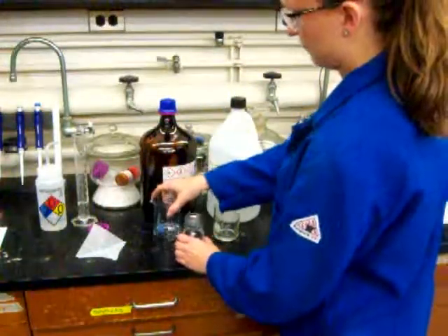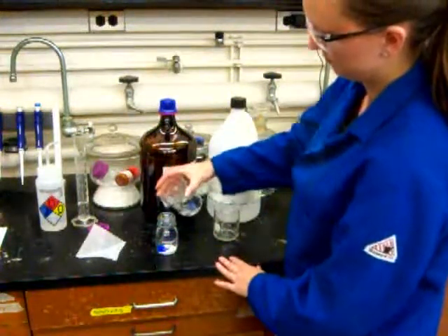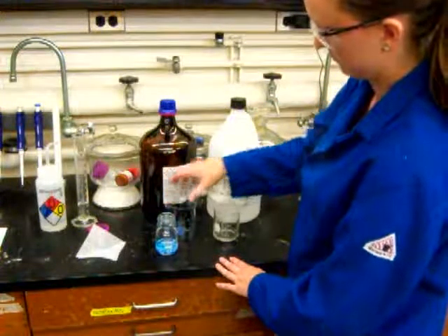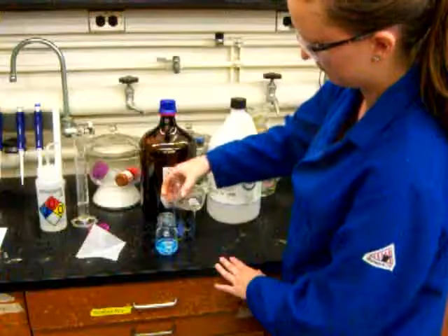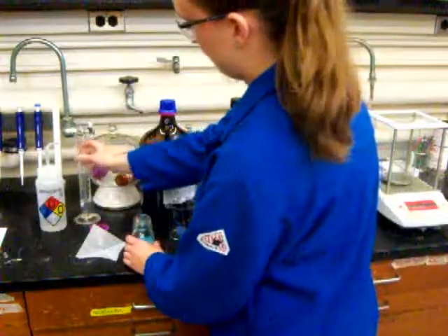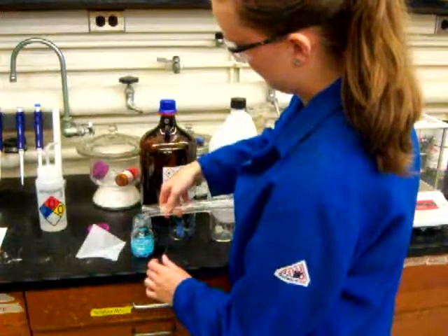So the next step is to add the solvent, the liquid reagents. She starts by adding dimethylformamide. You can see it's a clear, colorless liquid. And then next, our favorite molecule, ethanol. And finally, she adds a little bit of water to the reaction.